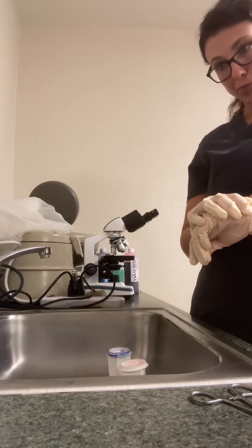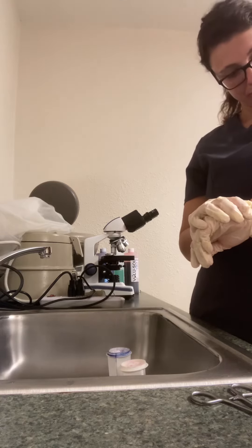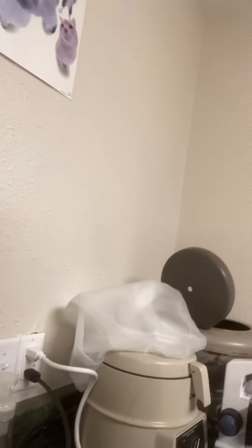And you're going to take your lid, take your lid off, and set it in there. Are you probing? And you can select that. If you want to select that first, you can do that too.